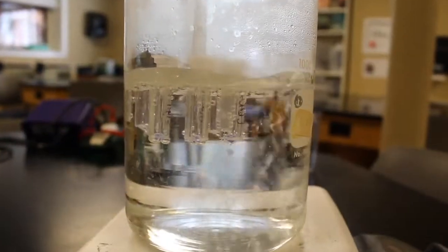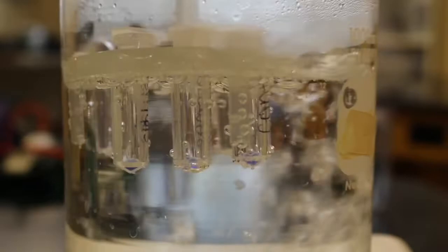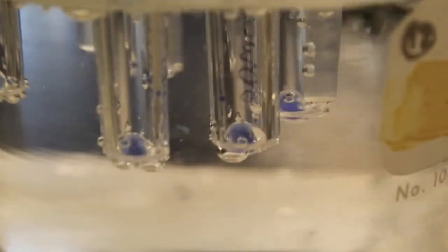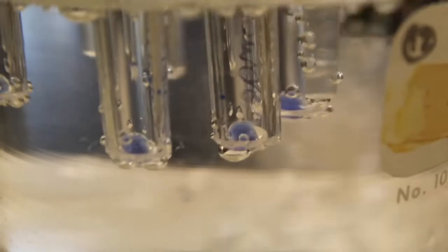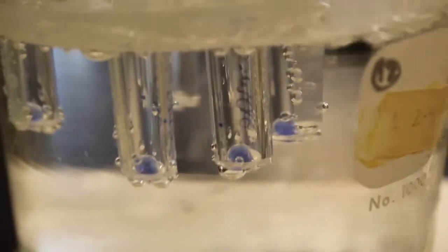Here we are heating our samples in boiling water. This process allows for the proteins in our samples to completely denature. As a protein denatures, it unfolds and allows the loading buffer to accumulate within the proteins by coating them with SDS molecules.